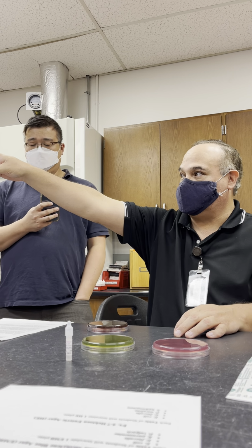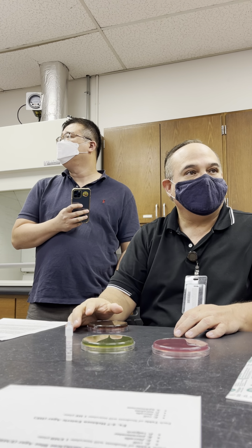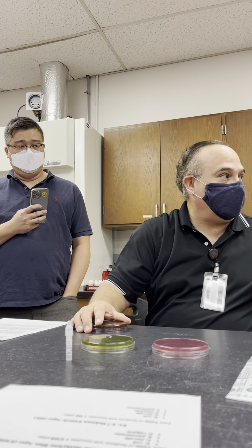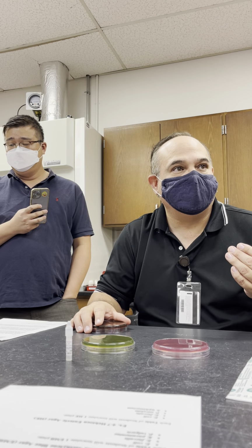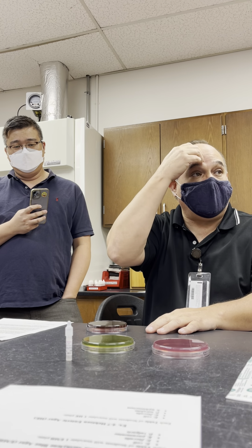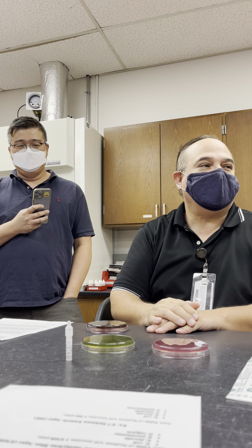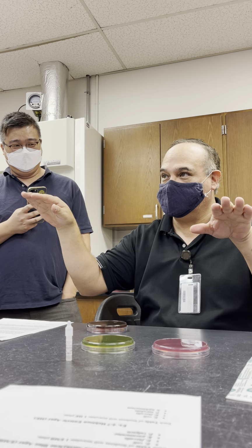This particular medium, EMB, was designed to test for water. You can see that's the first thing that's underlined. Its application is a test for water because it's looking for E. coli, because E. coli is a marker for fecal contamination. So we're not testing swimming pools. We're testing rivers and lakes and places like that. If the number of coliforms, or E. coli, are up, then we close the waterways. People cannot go swimming, okay?